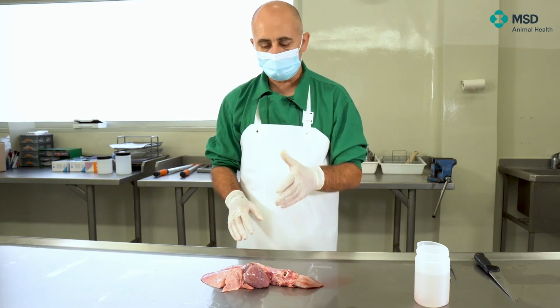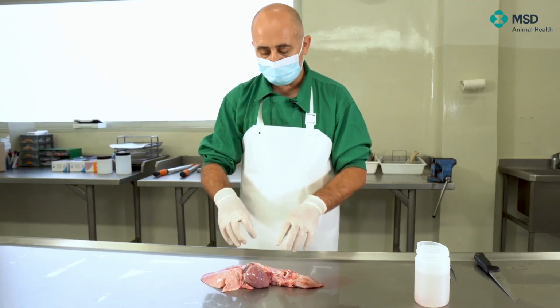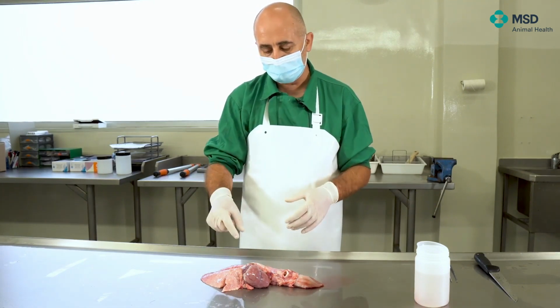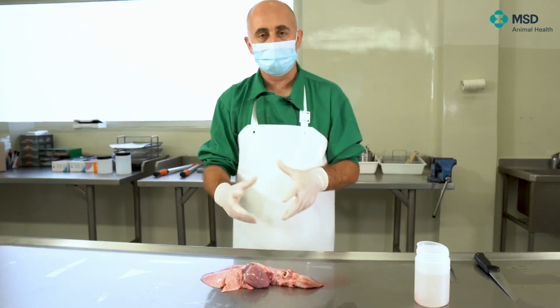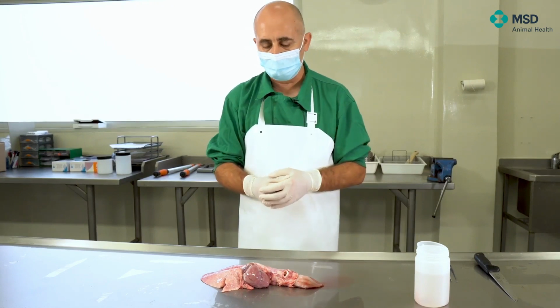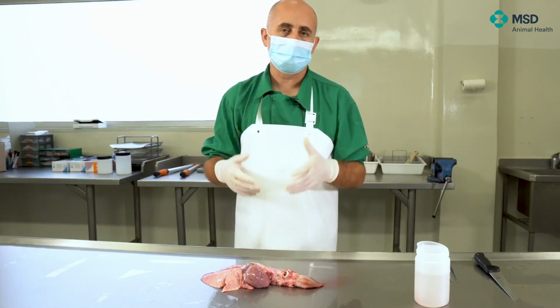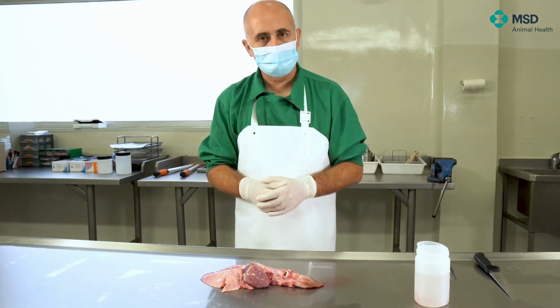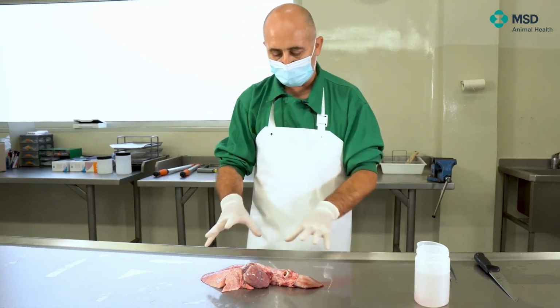Basically because we are interested to see if there's no kind of alteration, especially in the joint part of the big vessels that are going to the heart. Because if we are cutting directly, then it's very difficult to see anything. It's true, however, that in pigs, cardiac pathology is not that frequent, and this kind of alterations are not really common, not at all. So from this point of view, we will follow up together.